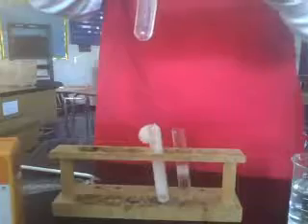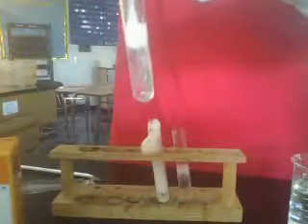Let's do for a base. Let's see, what would we do for a base? Okay. Let's add this. Now look at the reaction. We do get a reaction even though it's a little basic. And it might bubble over, but that's okay. And lastly, we're going to put it in just general water. Mix up the water a bit. There we go. And now we have a pretty intense reaction going on.